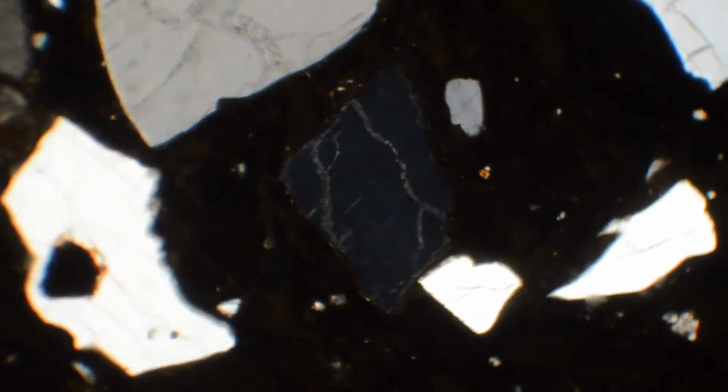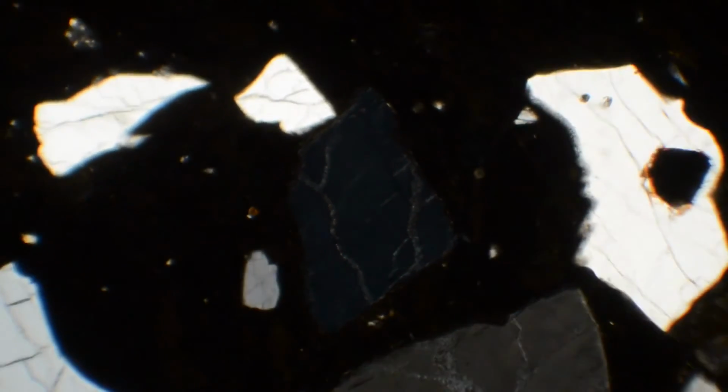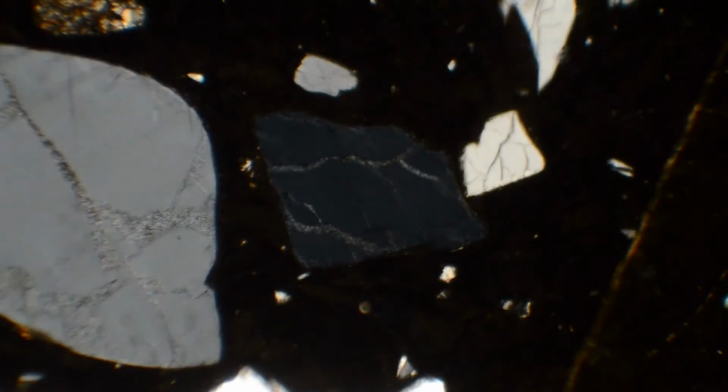Here, I start in cross-polarized light. As I rotate the stage, pick out what you think is the best grain to use. This grain in the center has the lowest retardation, so we should use that. Next, I will switch to the highest objective, focus, and then insert my Bertrand lens and my condensing lens. As I rotate the stage, observe the isogyres. Note that you can see both isogyres here, unlike our last example.